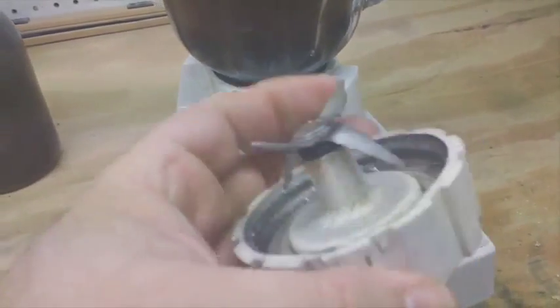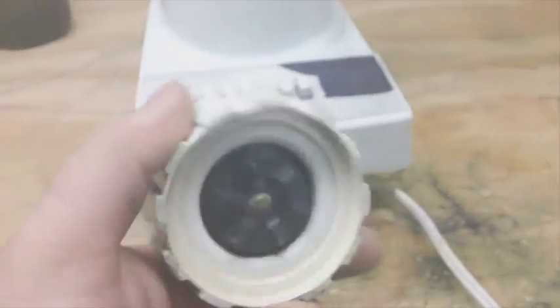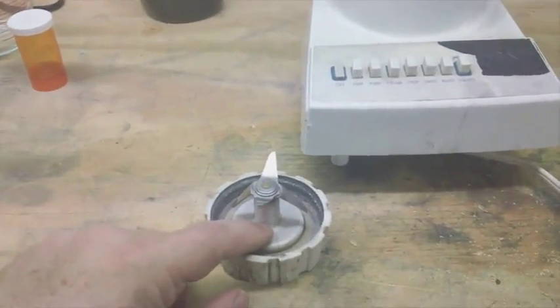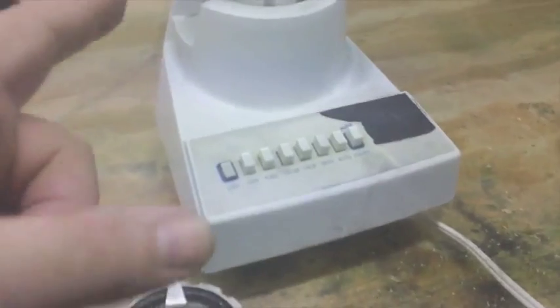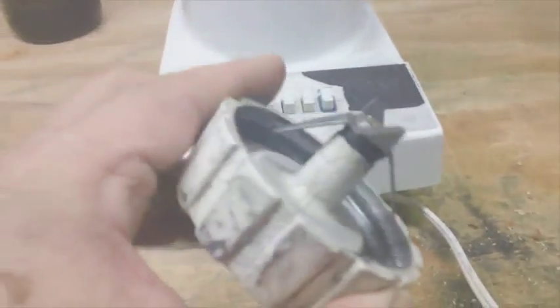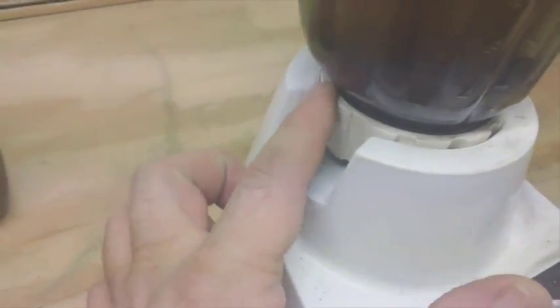I want to show you this base plate. The acetone has completely eaten it up — the bearing is now seizing. That was without the soap and my yield was so low I wasn't happy with it. I had two of these, found another one, and this time I put silicone rubber on the seal so it wouldn't leak, and also coated the plate with a thin coat of silicone rubber hoping it doesn't get destroyed. I have other blenders but I'm going to use this one until it fails — I want to know how durable it's going to be. PVC and acetone don't work well together, as you can see, but this one hasn't leaked at all because I sealed it, so it should be good for a while.